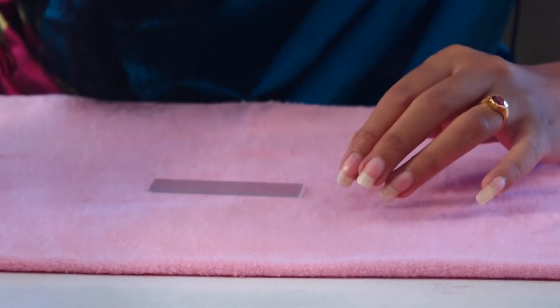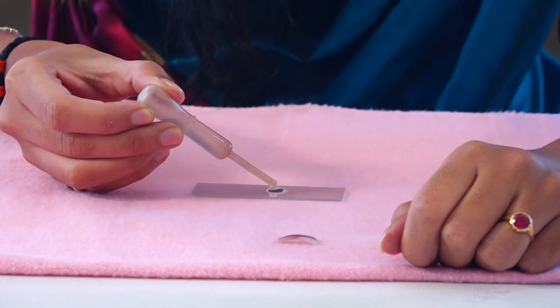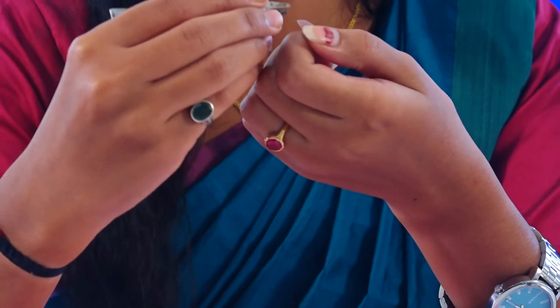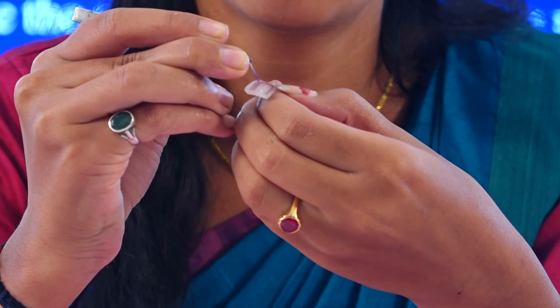First, we need to take a clean glass slide. Then take a fresh onion peel. We have a concentrated salt solution here — add 2 drops of this salt solution onto the slide. Then, to peel off the epidermal layer, with the help of forceps, carefully peel the onion in the correct manner to obtain the epidermal pink color layer.